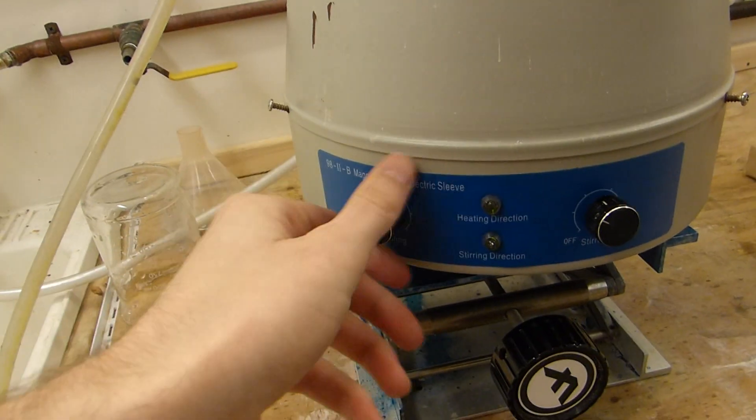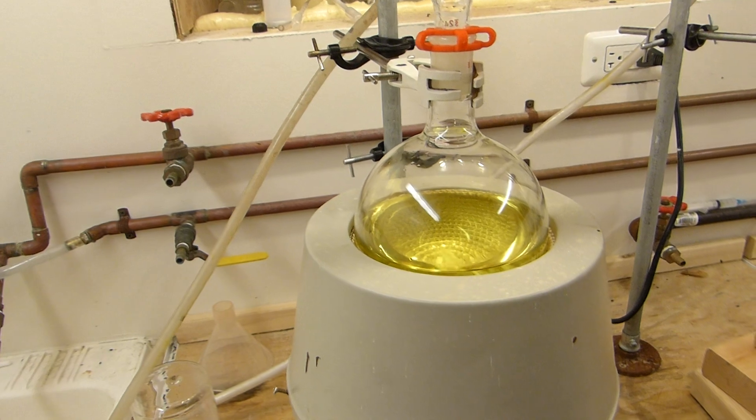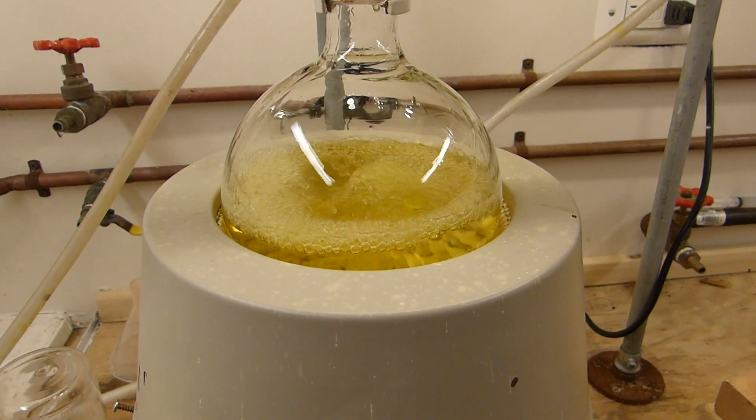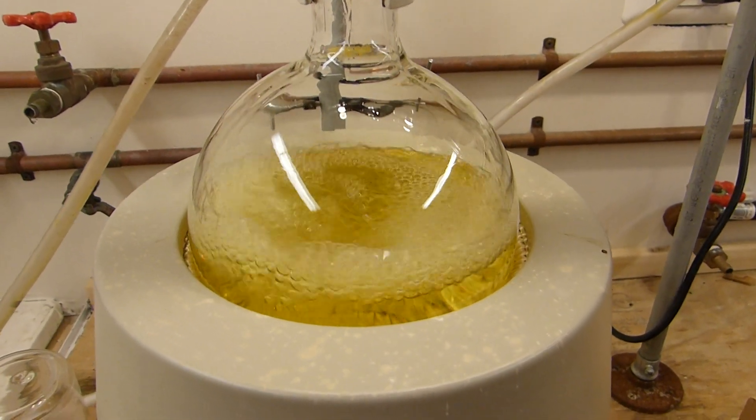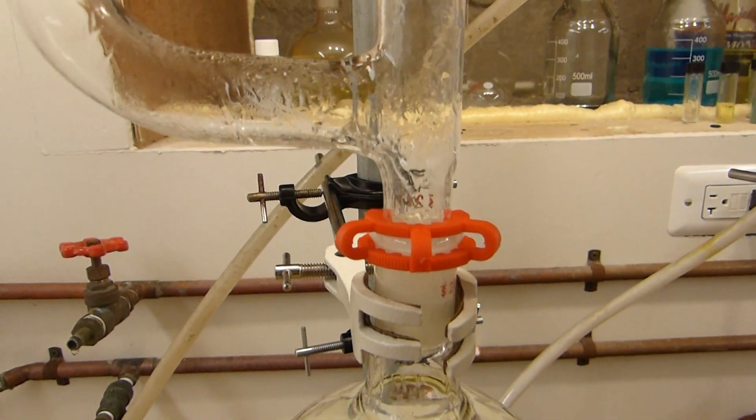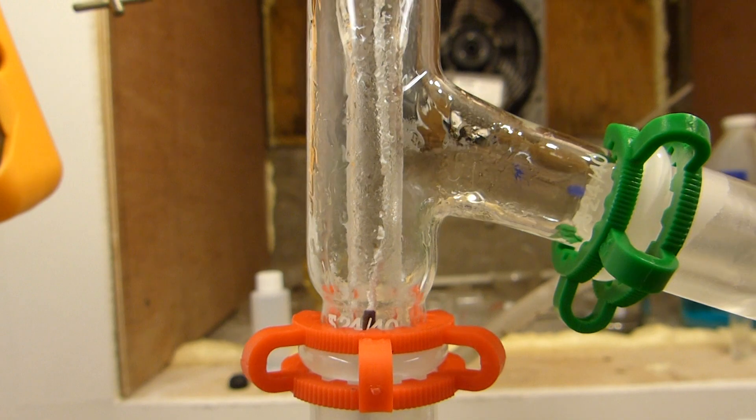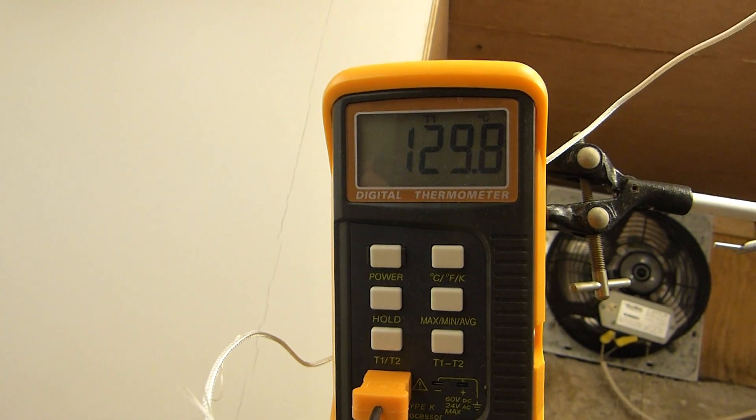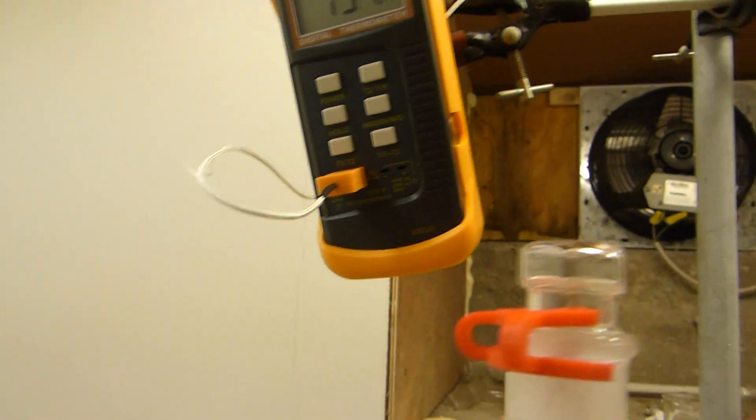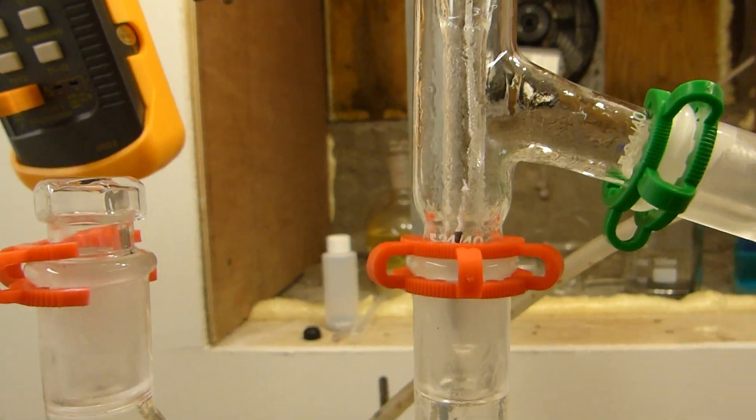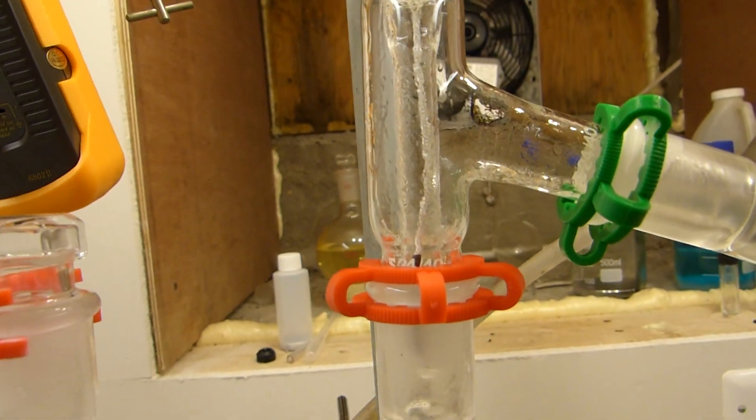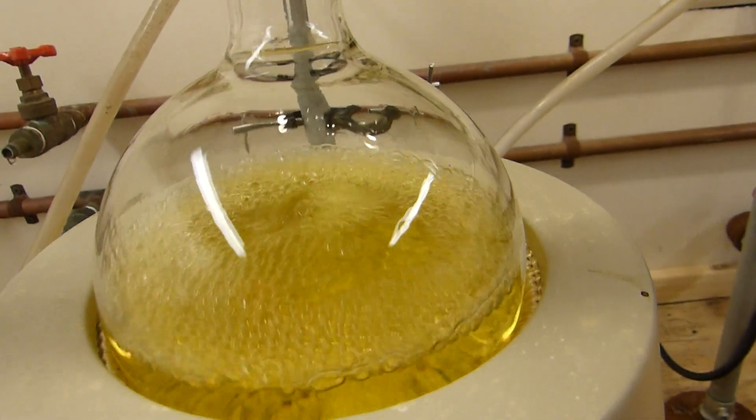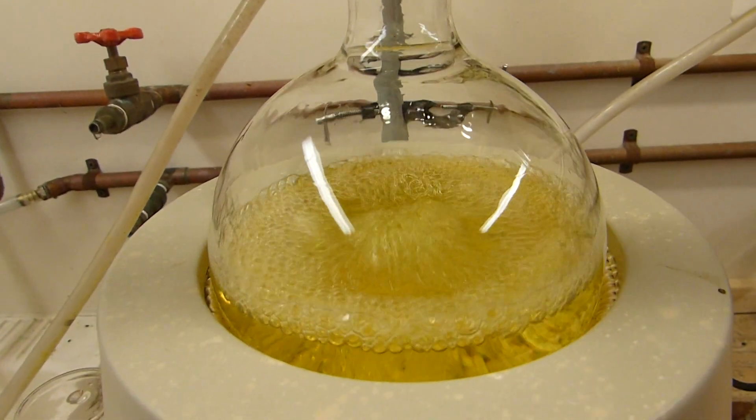We are now finally ready to turn on the heat and pretty soon the ethylene glycol will start boiling out of there. Now you can see that the ethylene glycol is starting to boil out of the solution and it's just now getting up into this upper tube here. Then of course our thermocouple hasn't had time to catch up because this front moves really fast. So we're at 125 and climbing very rapidly, 129, 130 and 31. So that should probably stop somewhere around 200. This may be a little wet, so the ethylene glycol coming off may be somewhere between 100 and 200. But water is not a problem for a lot of the experiments I'm doing with this, and I would generally dry before an experiment anyway, so I'm not going to feature that in this video.